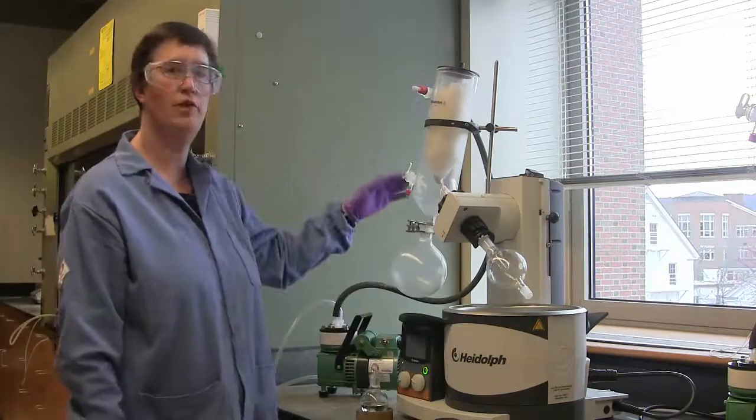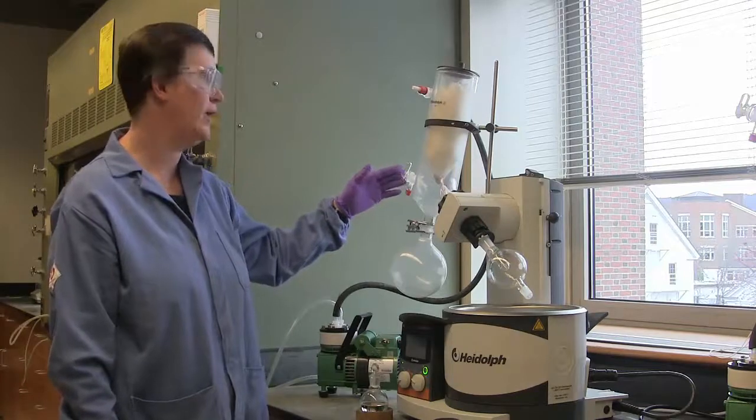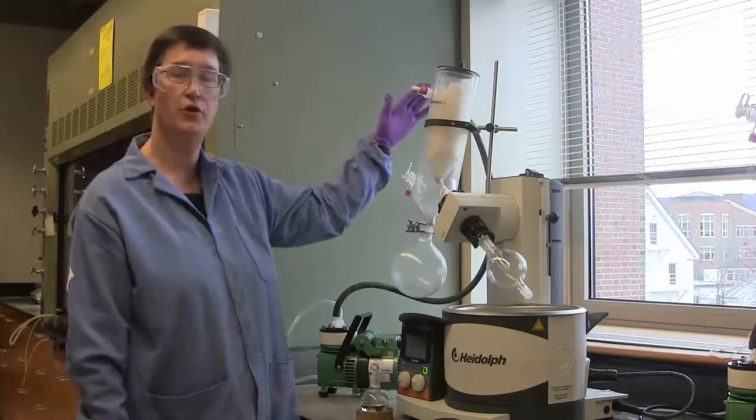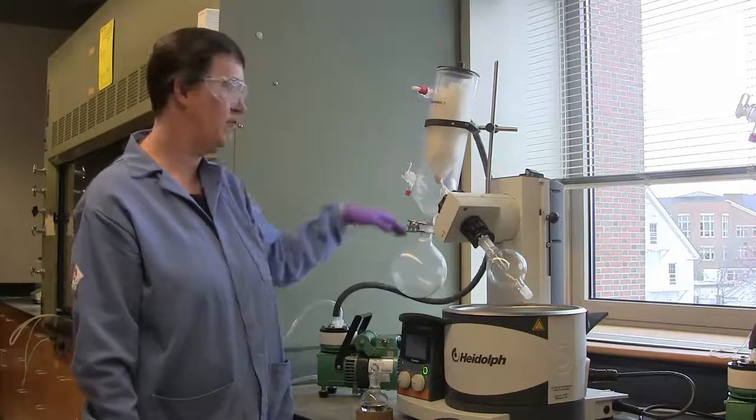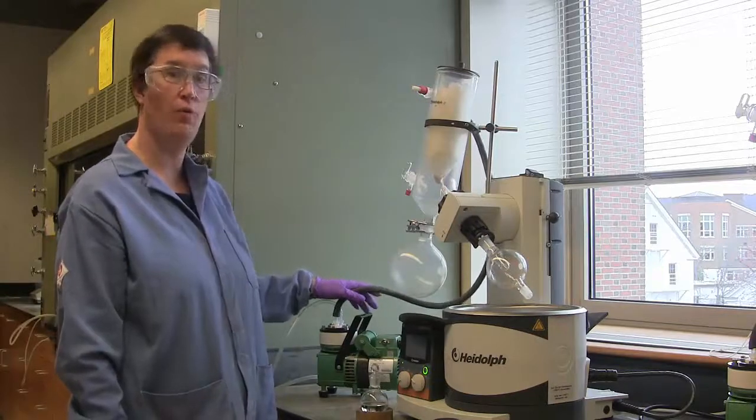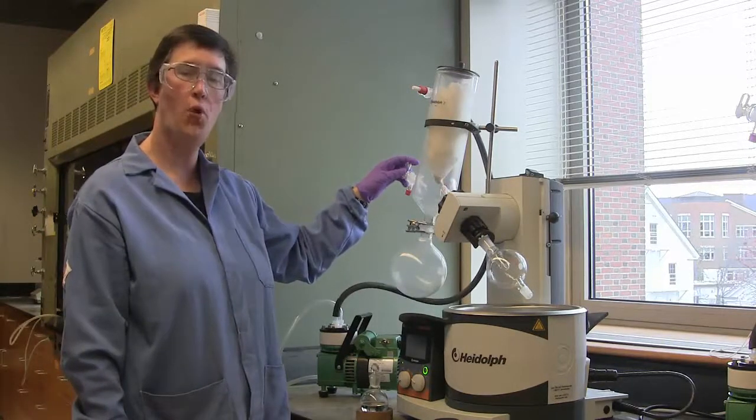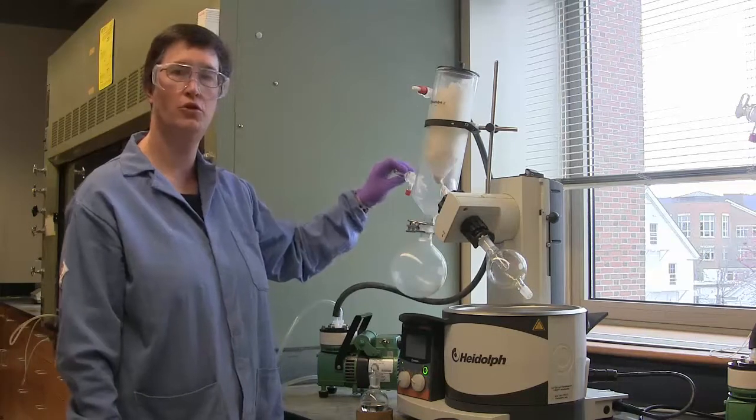There are two valves on the rotary evaporator that help control the vacuum. The upper valve should not be turned. It actually is open to our vacuum pump. It should remain that way.